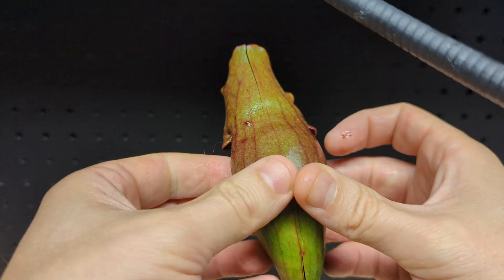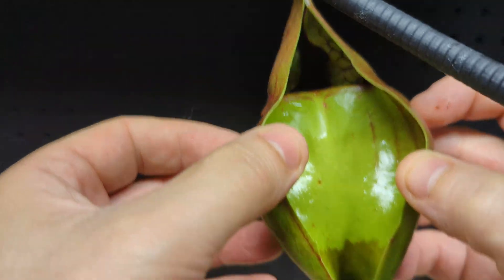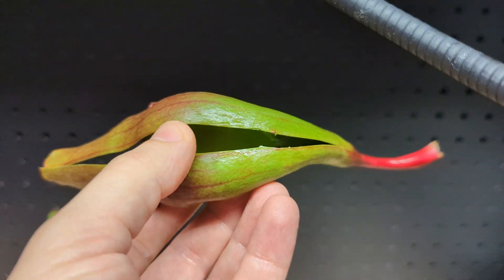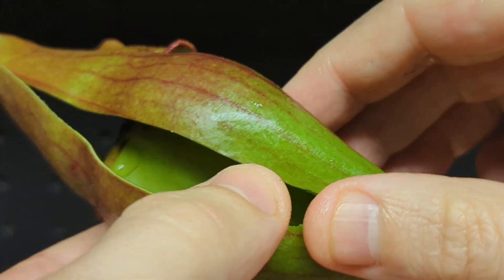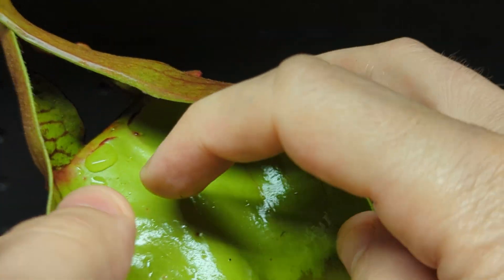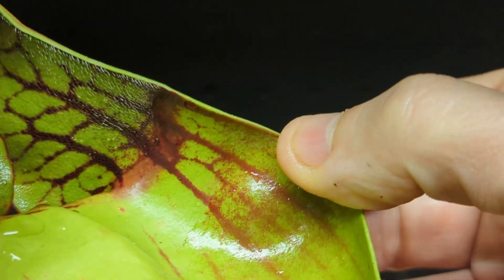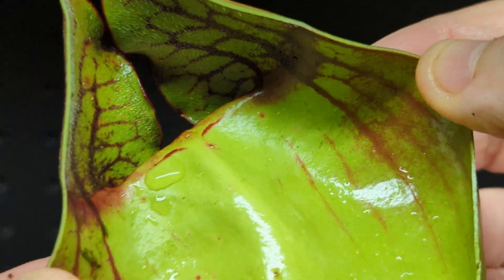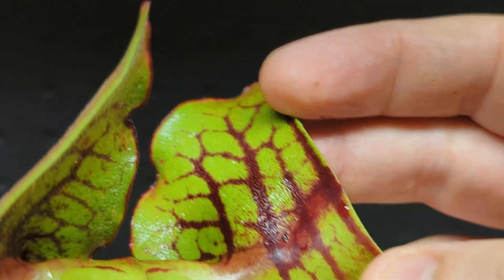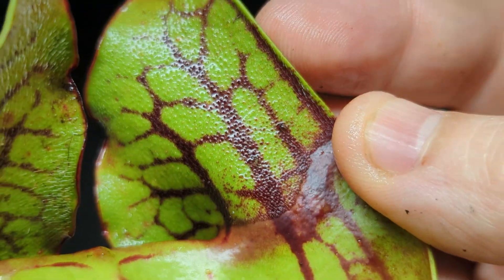The big reveal — it's very smooth at the top, but look down at the bottom: it looks almost like a stain down there. It's waxy to the touch, and there's a bunch of glands — or I should say absorptive cell patches — on there. It's on the smooth part that the plant absorbs nutrients, so you can kind of see the teeth on top.